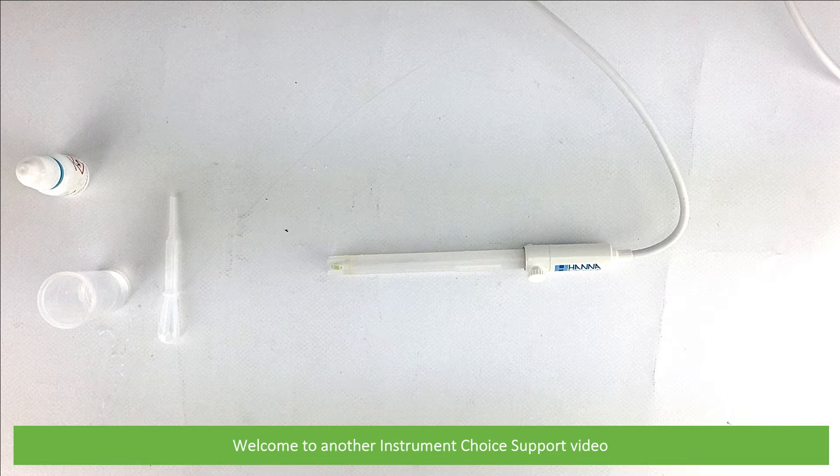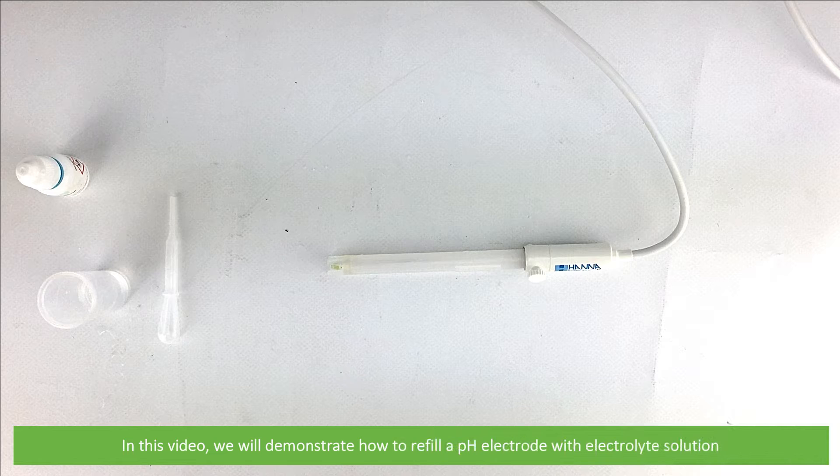Hi and welcome to another Instrument Choice support video. In this video, we'll demonstrate how to refill a pH electrode with electrolyte solution.